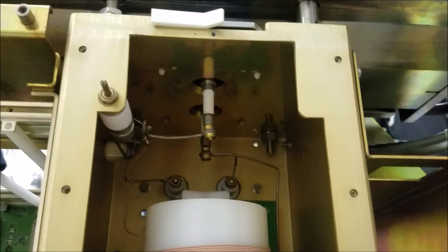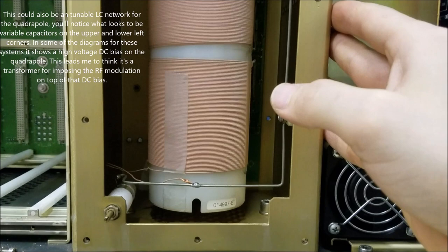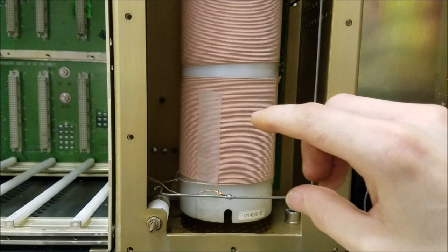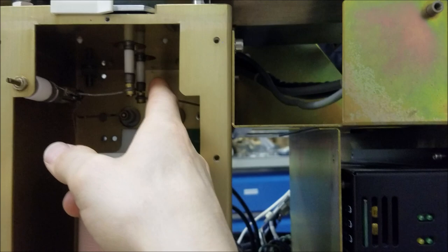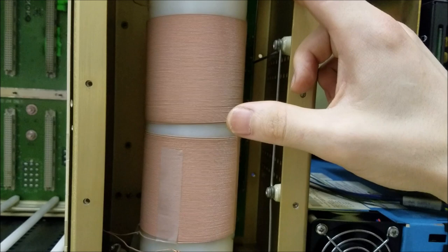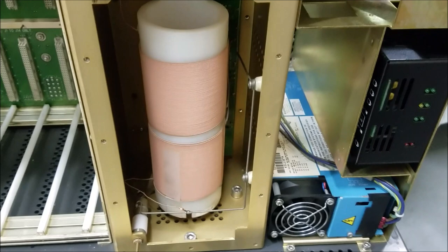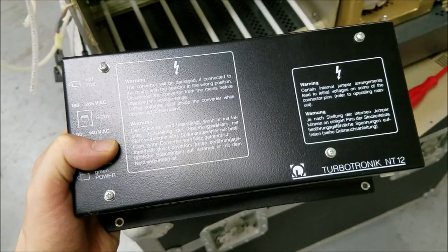This section here seems to securely hold the top section of the analyzer to what looks like an air-gap transformer. Basically what I think it does is it takes the RF generated by one of the cards and couples it to the secondary, and the secondary then puts the RF potential on two of those rods on the inside through these two inputs. So it's primary-secondary side, very fast switching — somewhere in the 1 to 2 MHz range from what I read — an RF isolation transformer. Cool stuff, but we're not going to take that off for the time being.